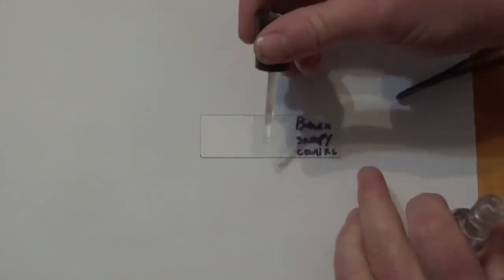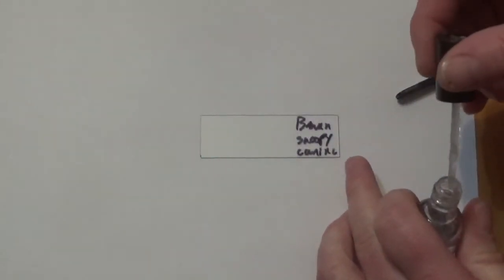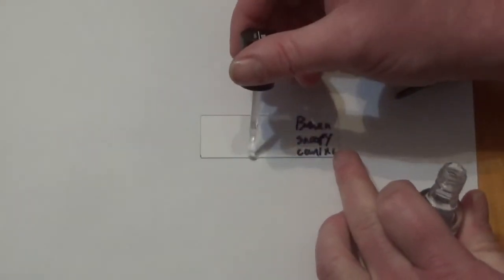I'll prepare another slide for the canine hair. Got a thin layer, I think I used a little too much before, very thin layer, clear nail polish. And then a hair sample.